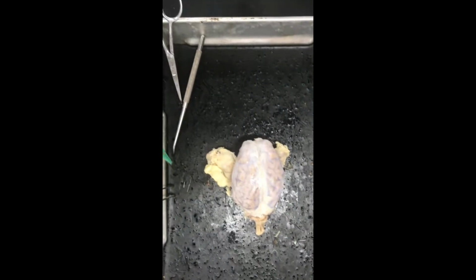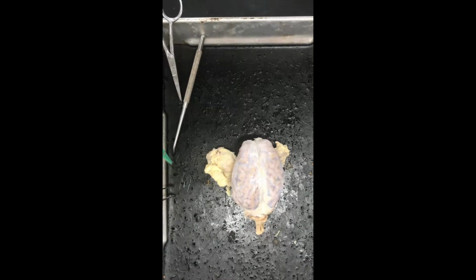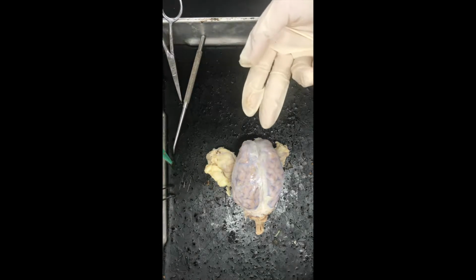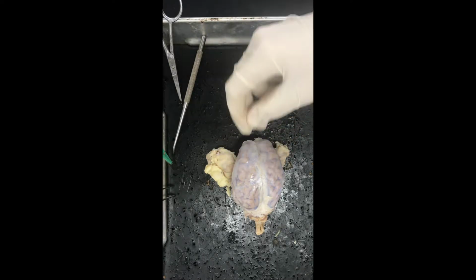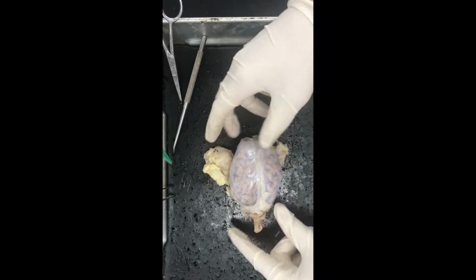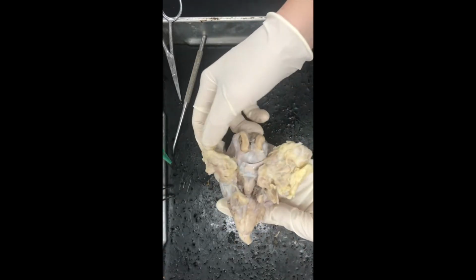Alrighty, so today we're going to be dissecting a sheep. Right now we're looking at it at a superior viewpoint. All brains have three protective membranes known as meninges. Today we're going to be looking at this milky white one, which is the outer layer known as the dura mater. Fun fact, there are two other meningeal membranes. The middle is called the arachnoid and the innermost is the pia mater.